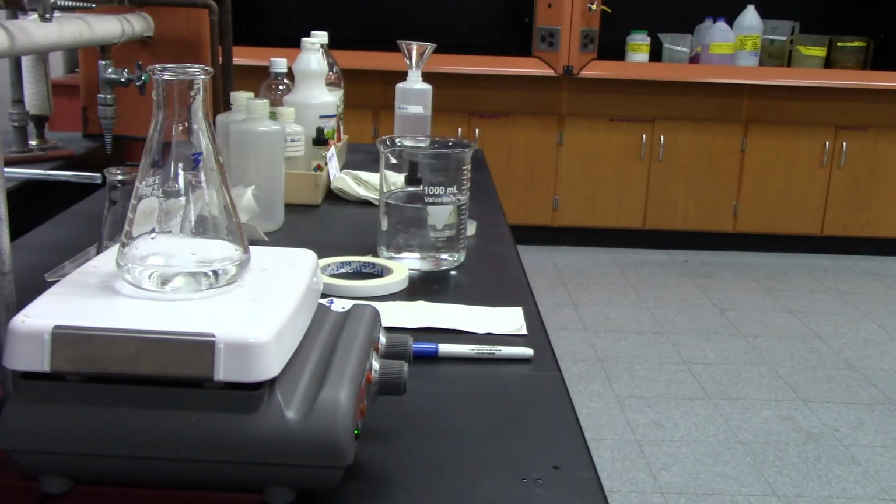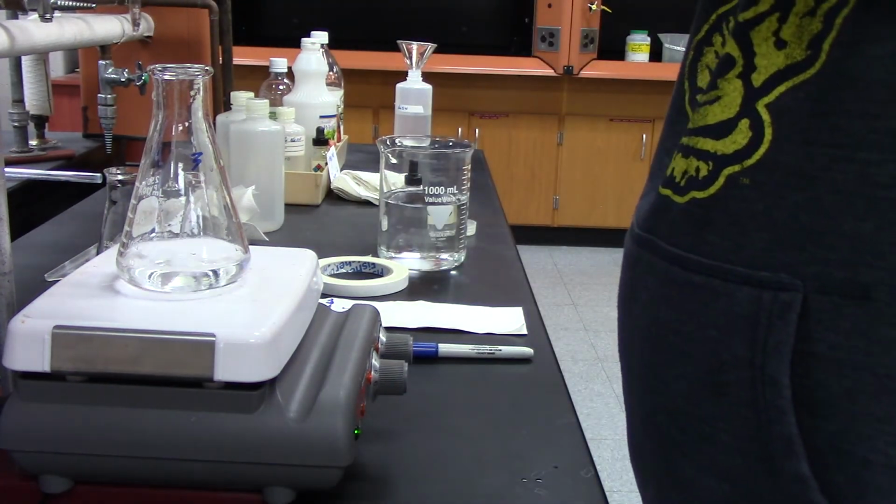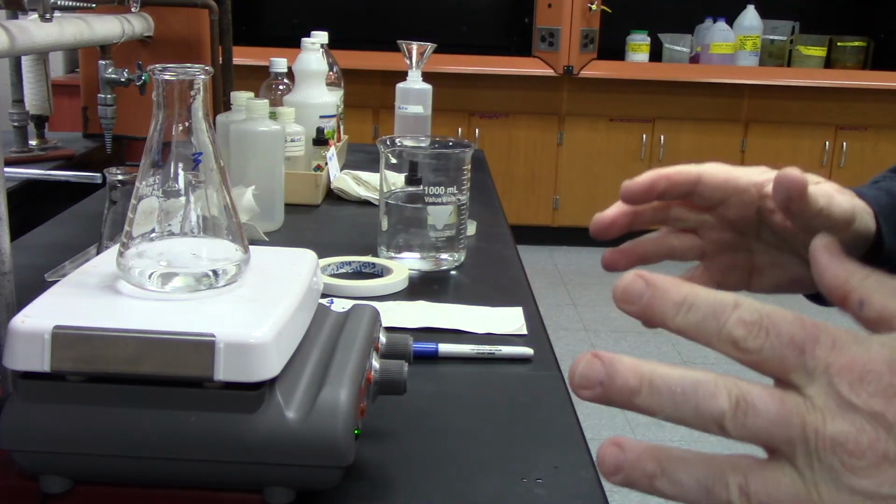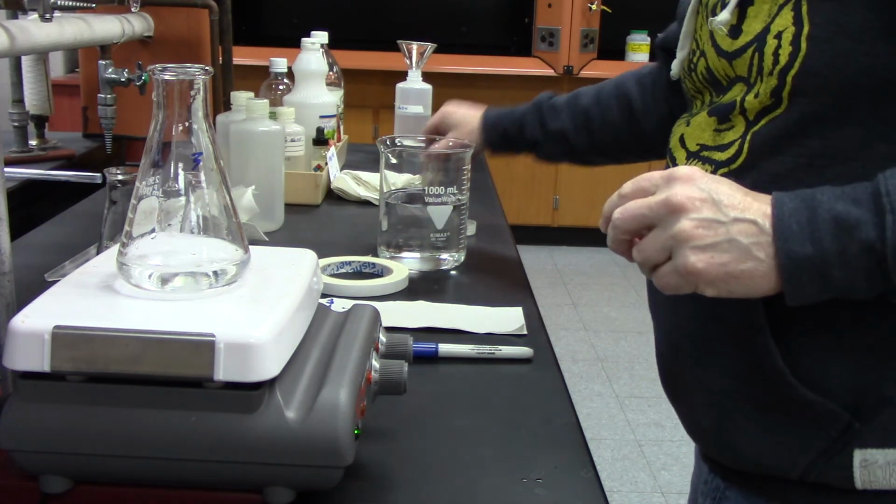So that's what I'm doing here. So I'd say 0.82 is my starting point. Okay, so each one has a different starting point, and each one will have a different finish point. But just make sure you record all your data.